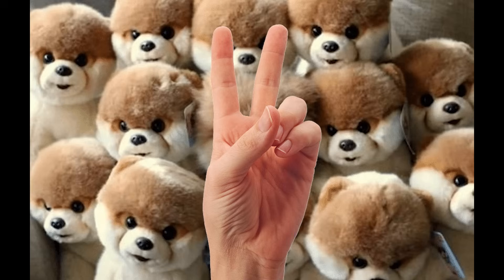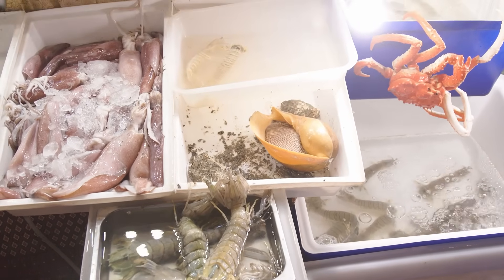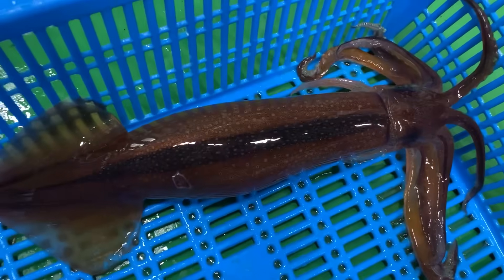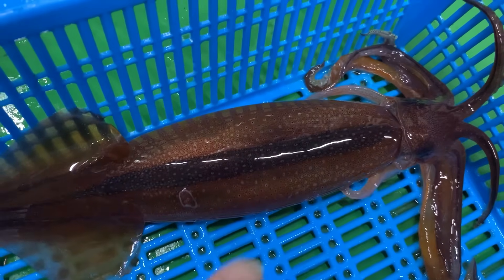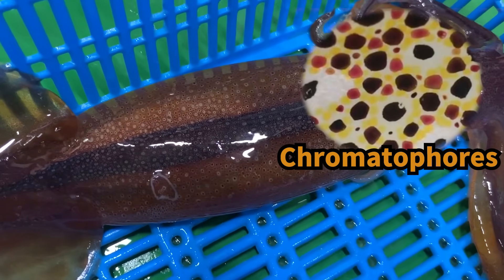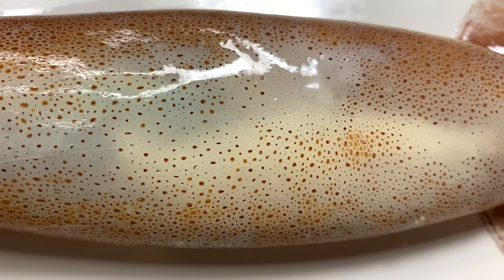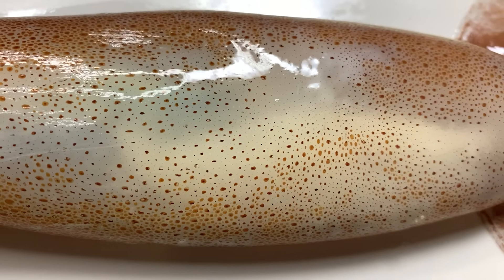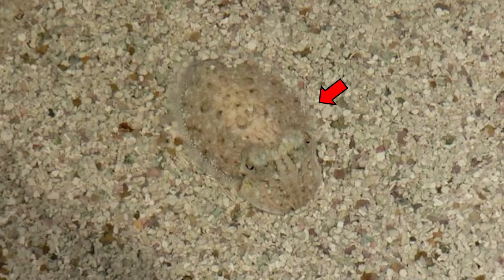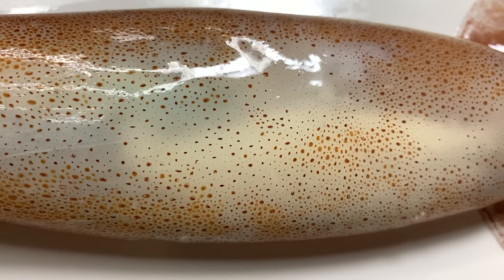There are two key reasons why they can do this. To find out, I went to a fresh fish shop. While frozen squid can be used for dissection, we chose fresh squid because some features can only be seen in live specimens. Chromatophores — pigment cells — are essential for camouflage. See how the color of the squid's skin changes? Cuttlefish use chromatophores to change body color and patterns to mimic their surroundings, blending into the sandy ocean floor. Their skin contains many chromatophores that make this possible.